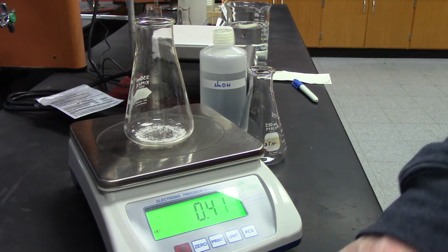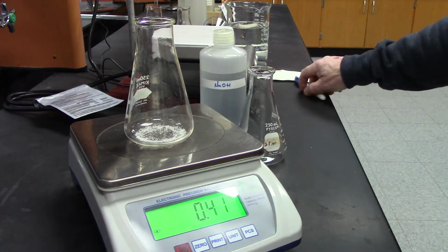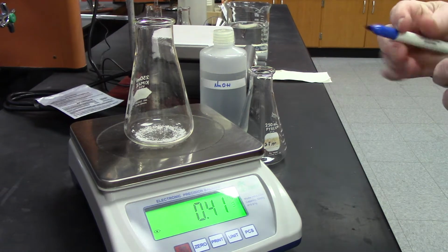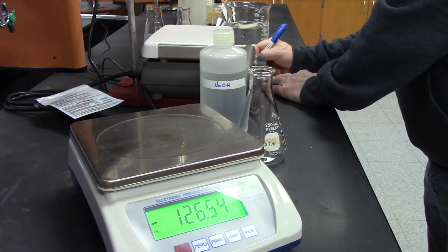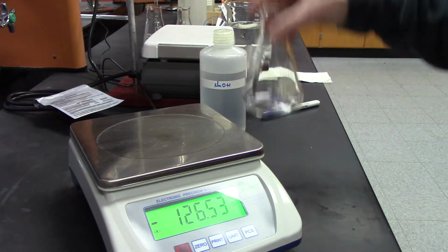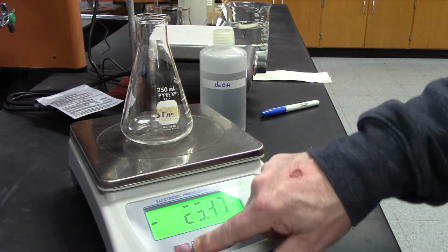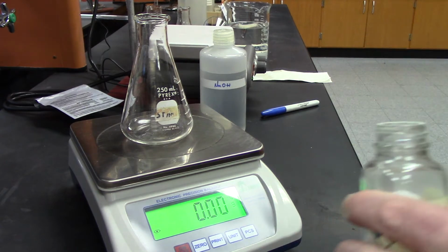All right, number 2 is going to be 0.41 also. Okay, I didn't do that on purpose. That's how it worked out. Okay, and third one, excuse me.